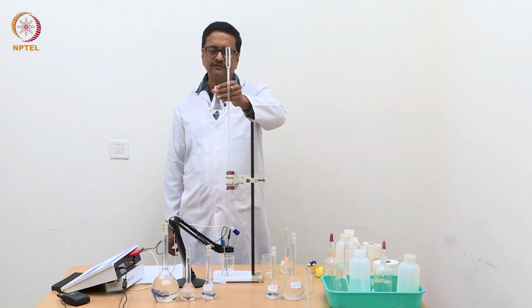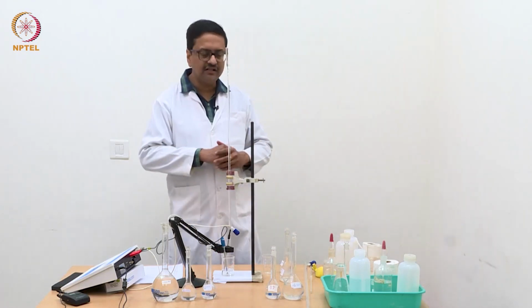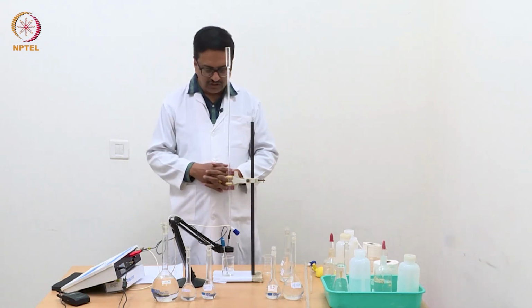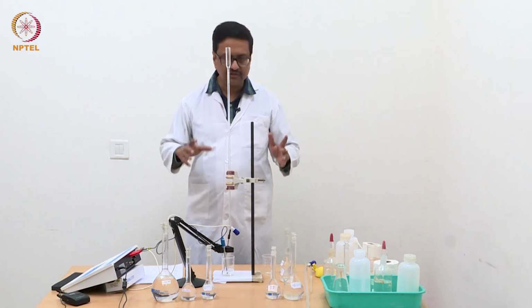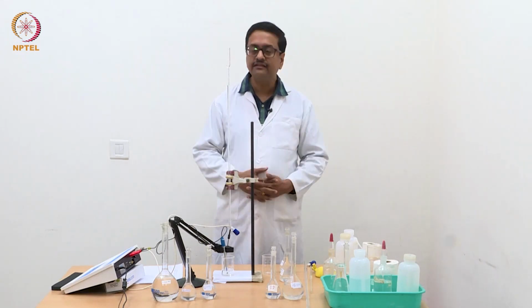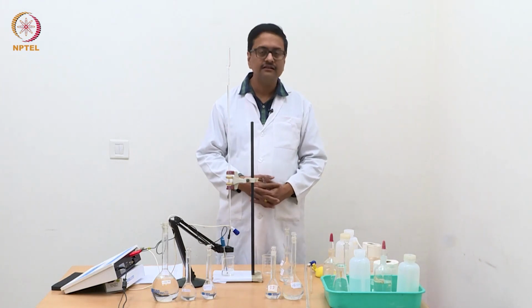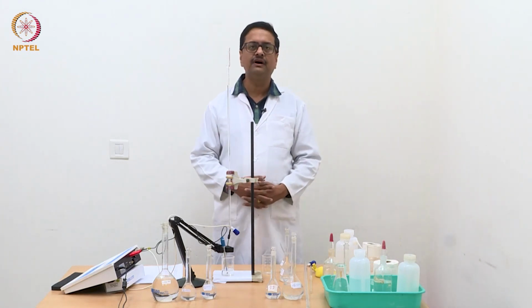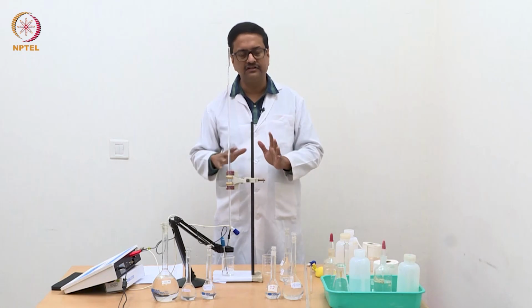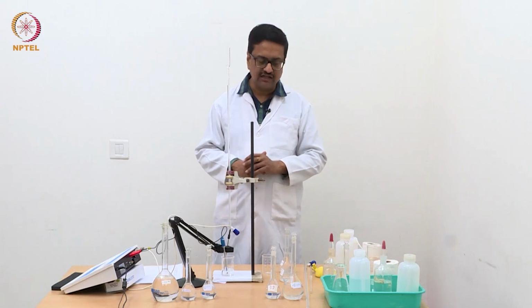Ammonium chloride is a salt of a strong acid and a weak base, and potassium chloride is a salt of a strong acid and a strong base. If we take this solution in a beaker and insert a conductivity cell, it will give the conductance of all the ions combined. When we titrate this triple mixture with NaOH, it will first react with HCl, consume H+ and replace it by Na+ ions, and the conductance will reduce. We will see a steep decrease till the H+ ions are consumed.